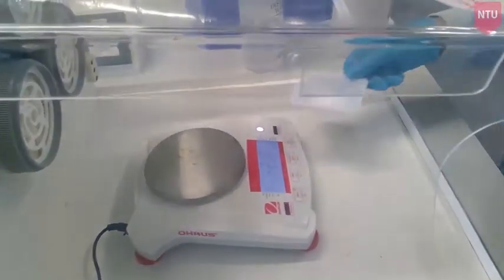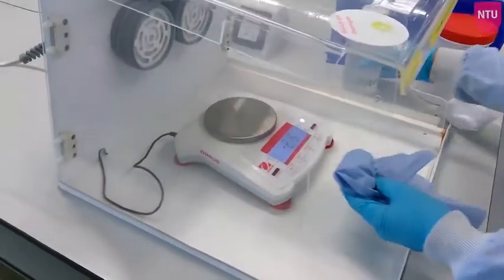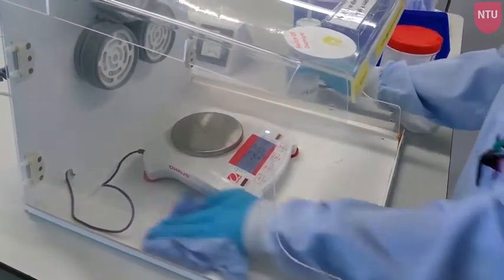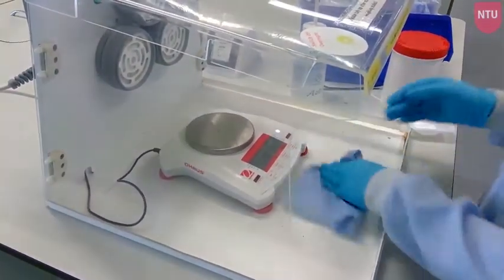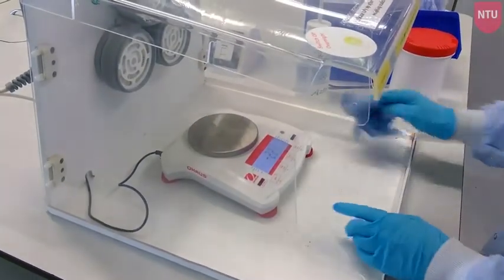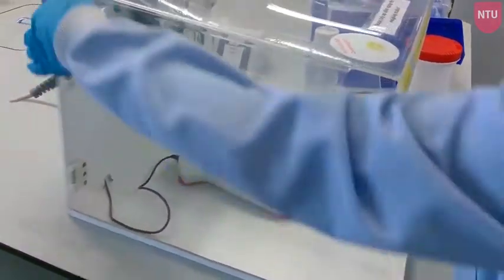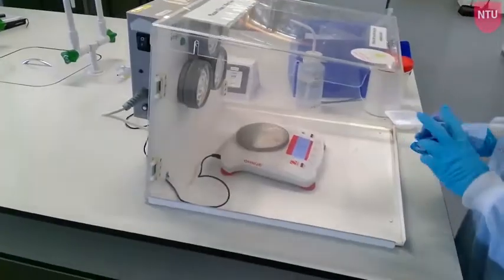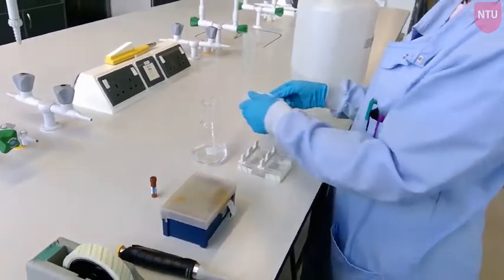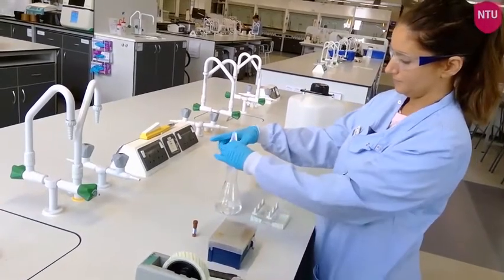Once you have weighed out the agarose, remove it from the balance and clean your spatula and the balance with Blue Roll and BioCleanse solution. Make sure you turn off all equipment as soon as you have finished with it.